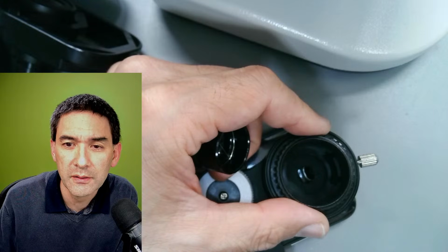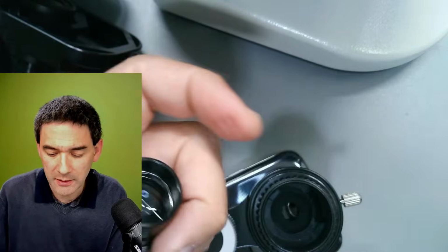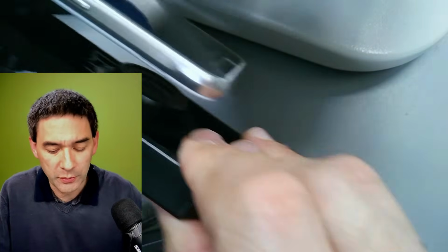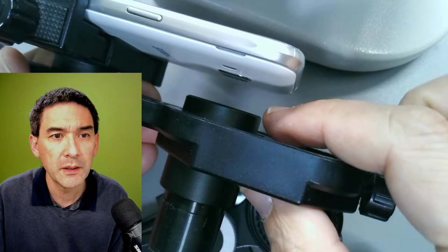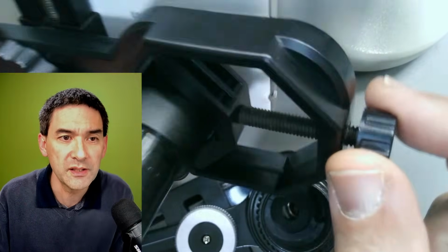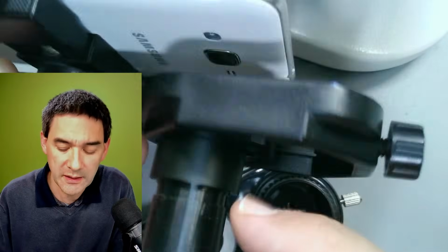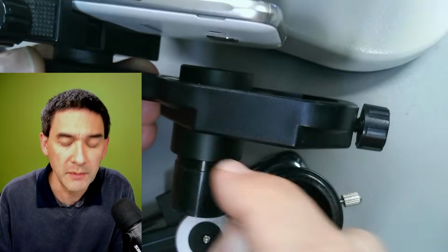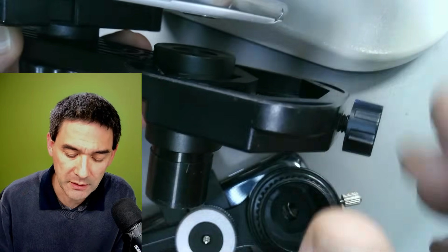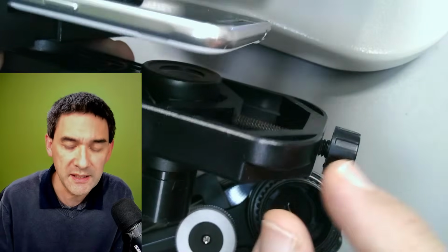Okay. So generally, what about the image quality? Let me put the other one in. No, before I do that, look here. Here I can adjust the distance by turning this. This is a clamp, and that's very solid. And then I can adjust the distance this way. For this reason, I always recommend that you buy yourself a separate eyepiece, get everything adjusted, and keep the whole setup as it is.